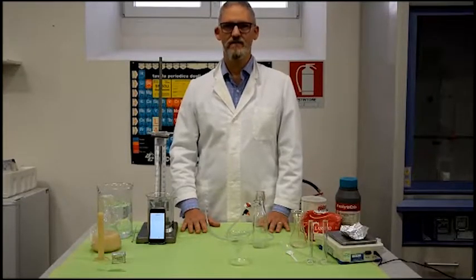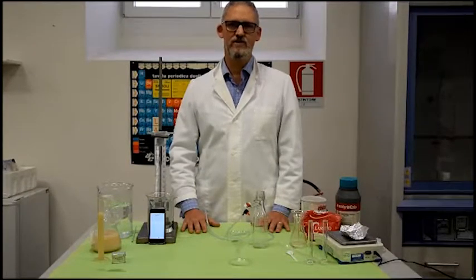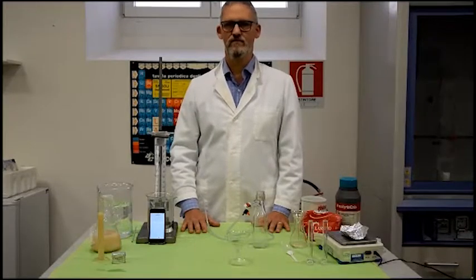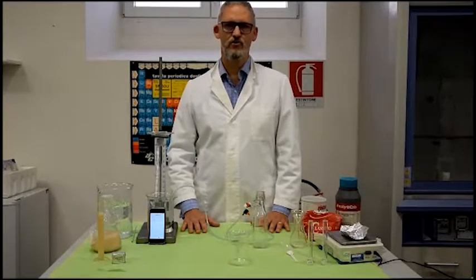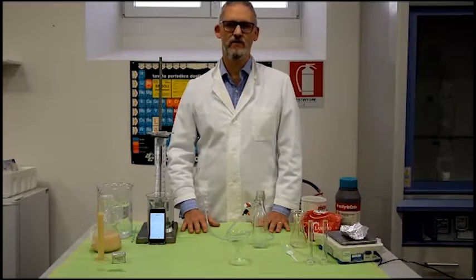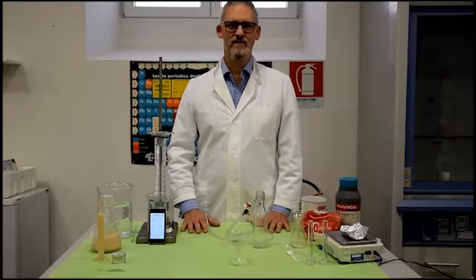The second part of the laboratory is to look at yeast fermentation using different carbohydrate sources, for example glucose, fructose and other sugars. The third laboratory experience is to compare the carbon dioxide production during fermentation with yeast to the carbon dioxide production using chemical raising agents. So, I'd like to hand over to Anastasia, who is now going to demonstrate the first part of this experiment.